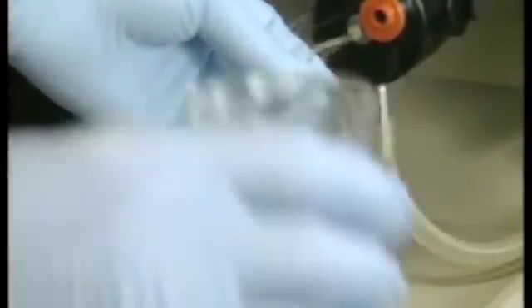Finally, aspirate distilled water for a couple of minutes to thoroughly clean out the nebulizer. Then switch off. For non-automated instruments, carefully follow the shutdown procedure.